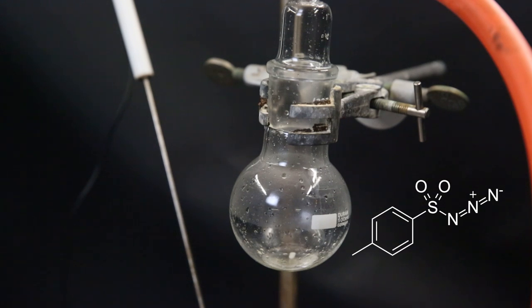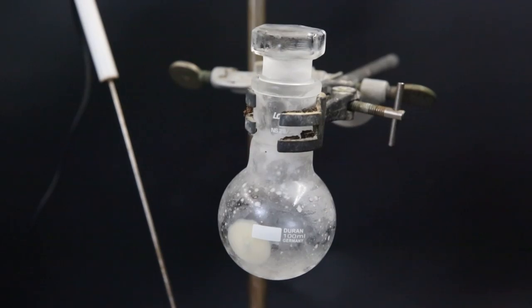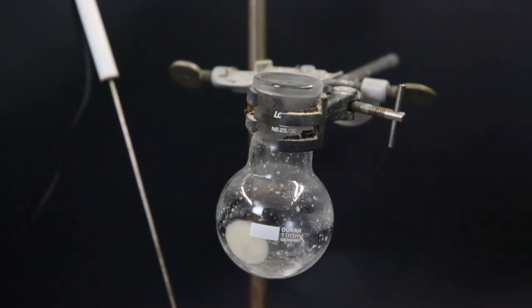The azide has a melting point that is very close to room temperature. So I put it in the freezer overnight. When I come back the next day, it has all become a white solid. Now I let it come to room temperature and it stays as a solid.